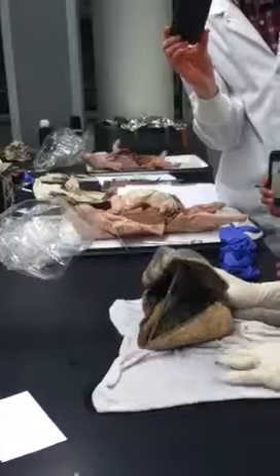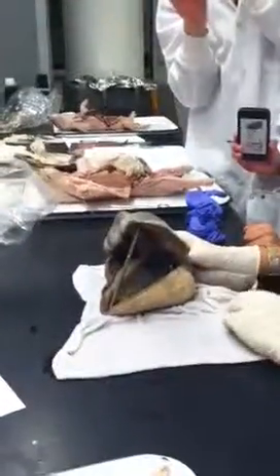And I think that's everything. Any questions? Why is it diseased or something? Like, why is it black? Or is that just... This part is so old. I want to say maybe 7 or 8 years. So it just changed color over time.